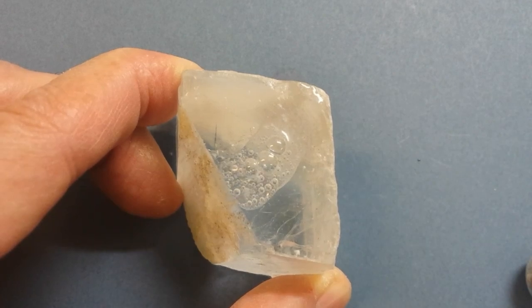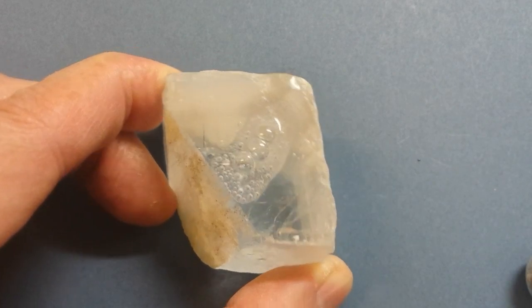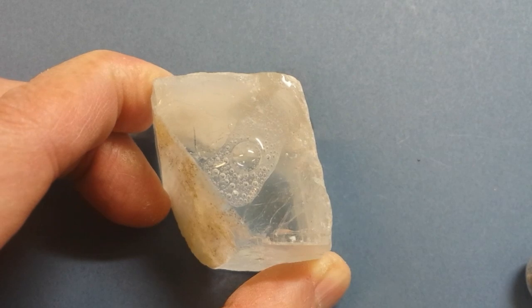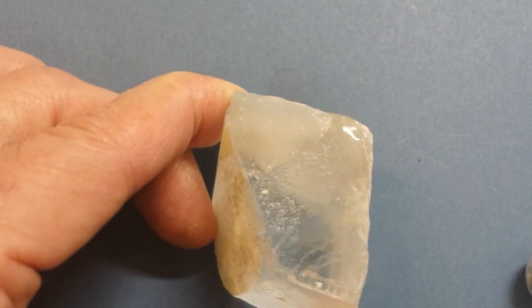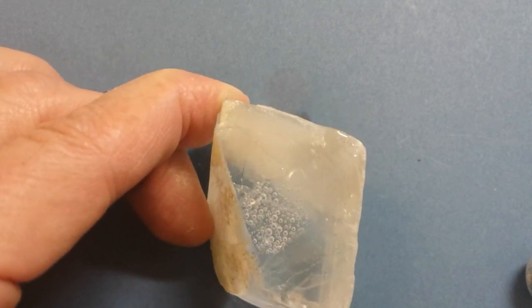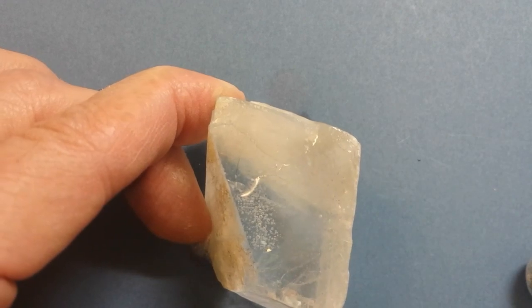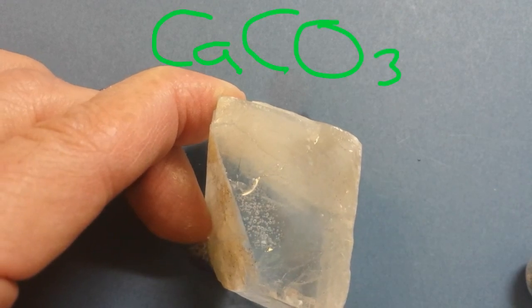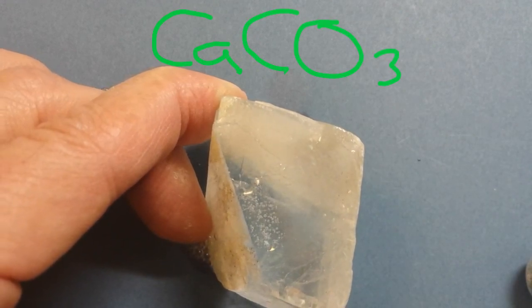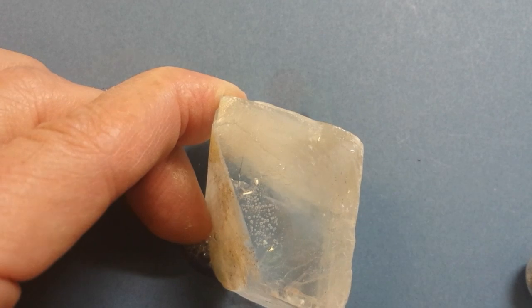A reaction of this type is characteristic of only a few common minerals. The most common of these is calcite. Only relatively pure calcium carbonate, CaCO3, in bulk crystalline form, will react this strongly.